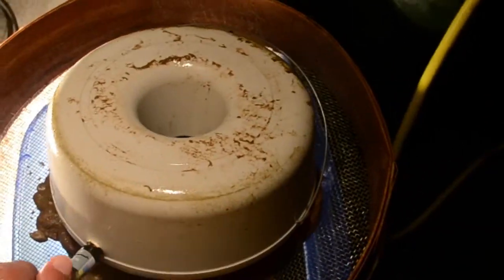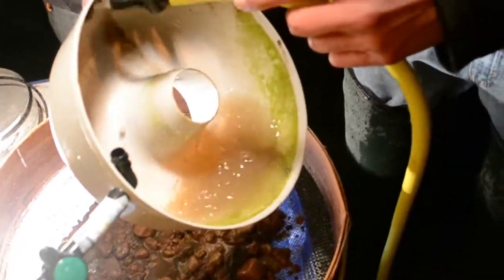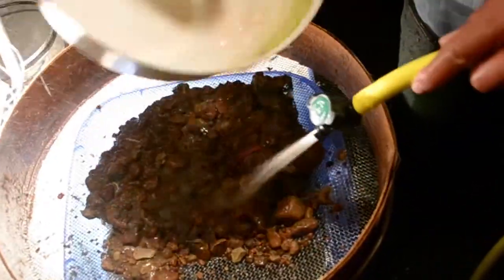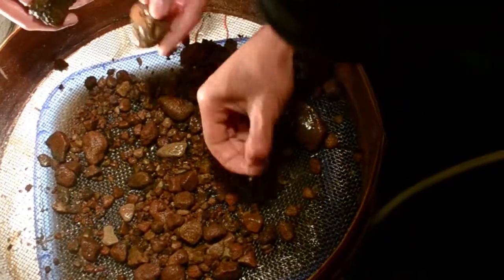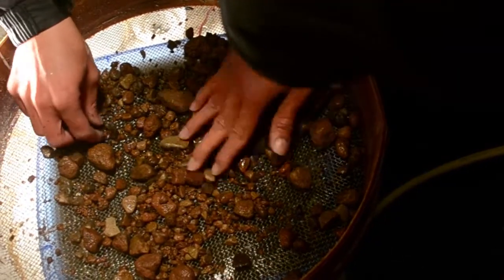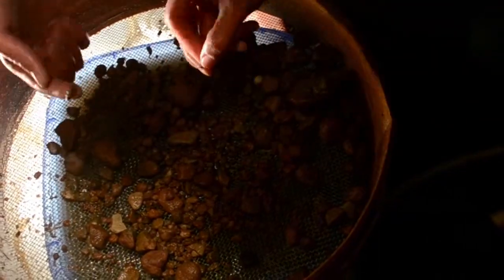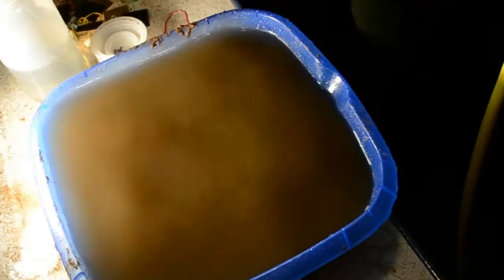The channel is transferred to the sampling station. The container with the corresponding channel number is selected. It contains some ethanol to preserve the insects. The channel is rinsed with water, and the sand as well as small organisms fall through the sieve into the tub. The gravel on top of the sieve is searched for bigger organisms like caddisflies or gammarids, which are transferred directly into the sampling container. After carefully picking out all the organisms, the gravel is discarded.